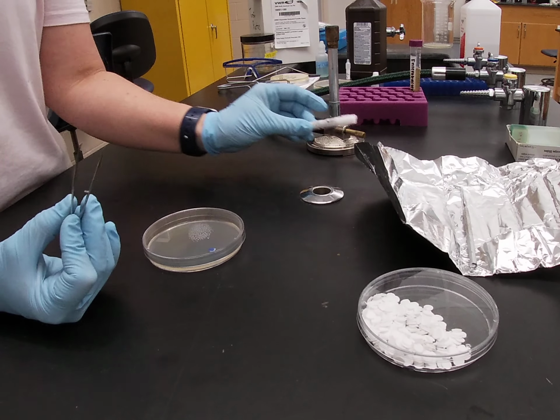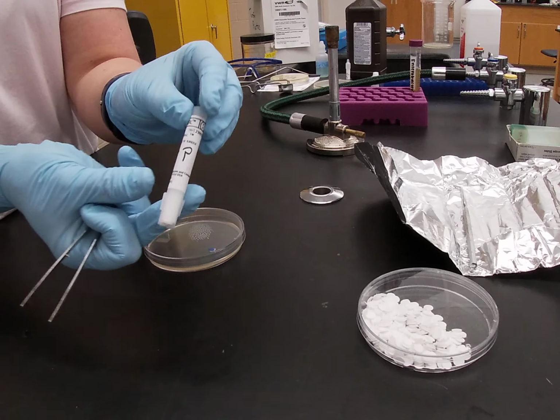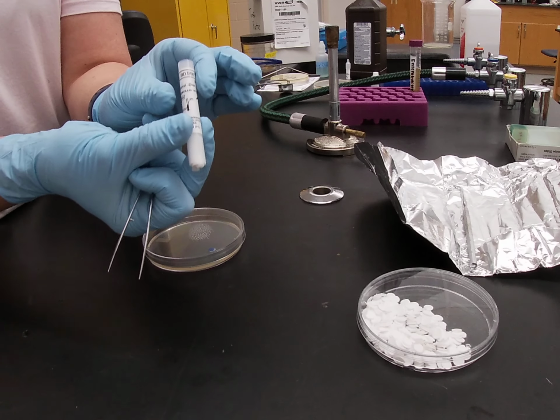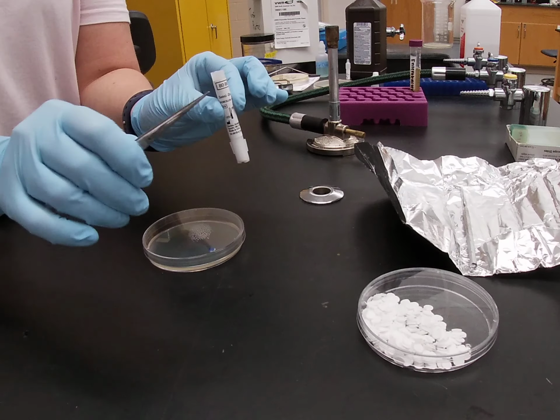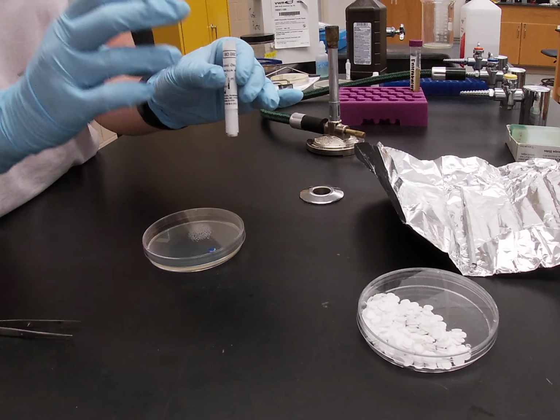When we test antibiotics and test to see if bacteria are sensitive or resistant to antibiotics, we generally buy those in pre-made discs. Here you can see discs with penicillin in them. We use these a lot when we're doing our unknowns, and when you need to remove a disc from one of these tubes, you can either use forceps if you have them, or you can use your inoculating loop. You just sterilize your loop in the way that you usually do.